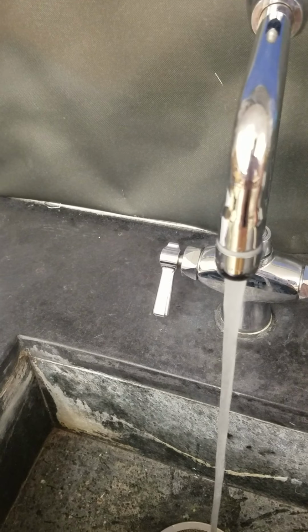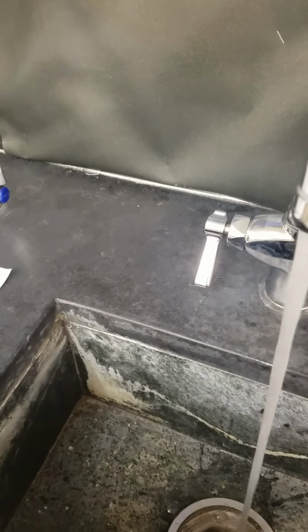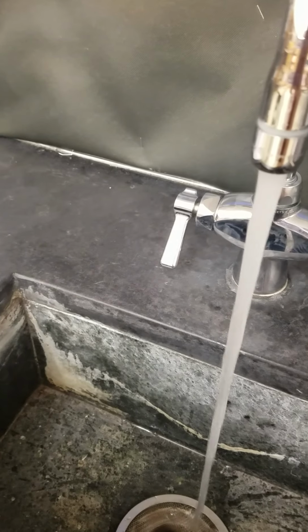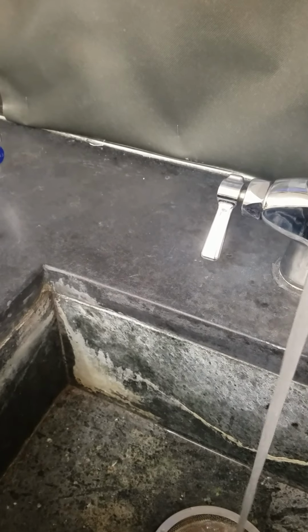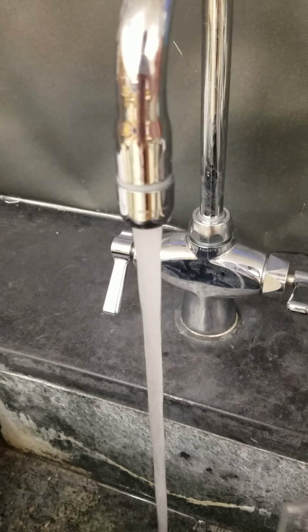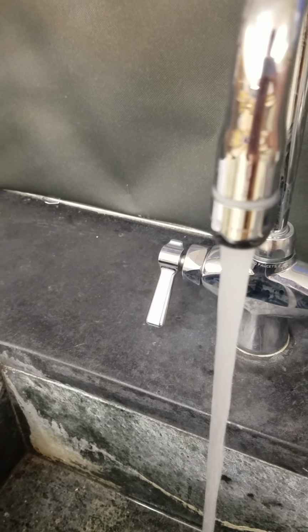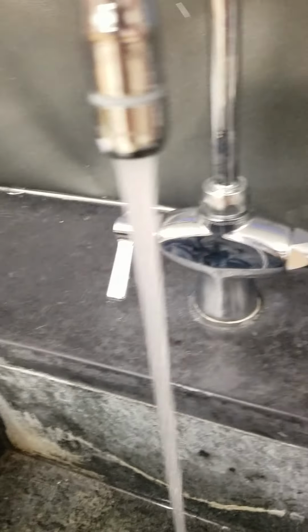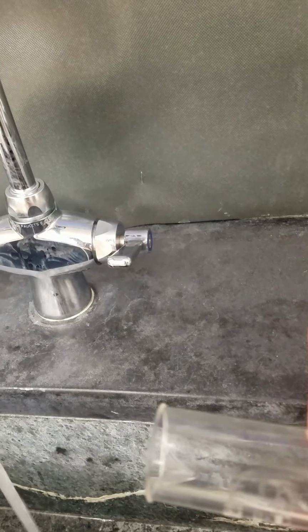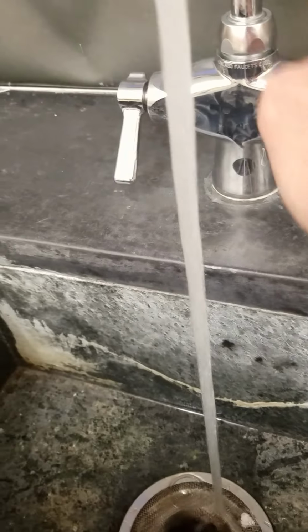And I have to make sure that it's exactly at 60. Which isn't always easy. And what I'm going to do is watch to see how much the water level rises when I add the piece of slate in there. Okay, just a little bit more. Okay, I think that's exactly at 60.